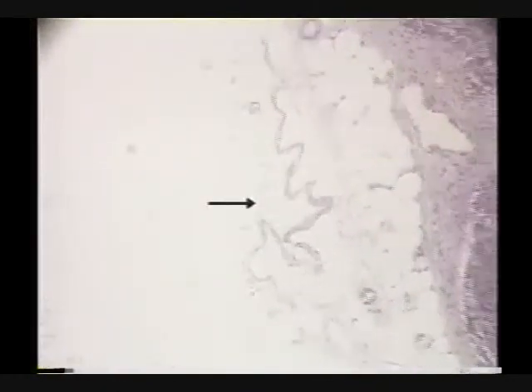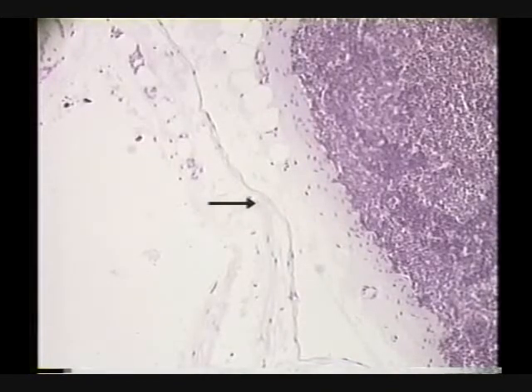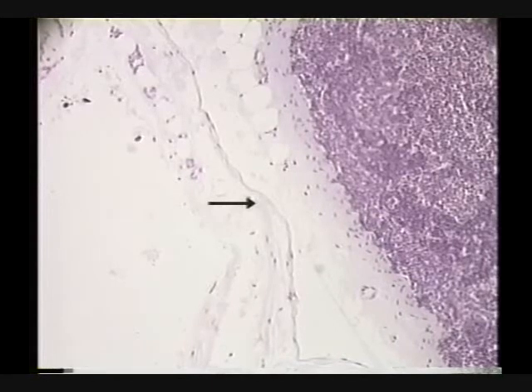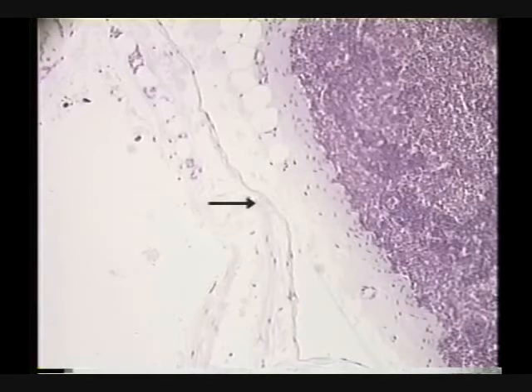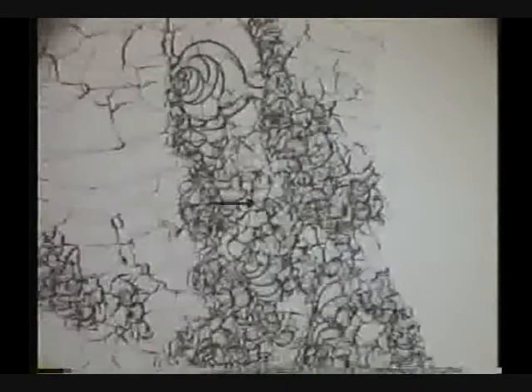I don't see a lymphatic vessel here that we could zero in on and find a valve - that'll happen randomly when we're studying something else and I'll bring it to your attention. The last slide - well, there's our old friend glue. This slide delaminates; I don't know why. There it is.